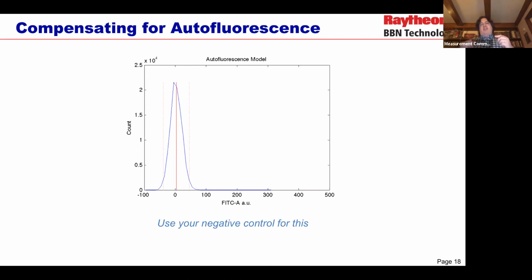So the instrument is giving us these fluorescence values through interpreting a voltage on the detector. And so there's just a little bit of noise in that. And on a range of, say, 10 to the 5th, going up and down a couple hundred is not unusual. But you can see there's a tiny little nudge to the right here. So we're going to end up subtracting just a couple units. And this also tells us where is the minimum level that we can rely on a number. Once we start getting down into the instrument range, any measurement less than about 50 should be considered suspect, because at that point, we're really getting entangled with instrument noise.